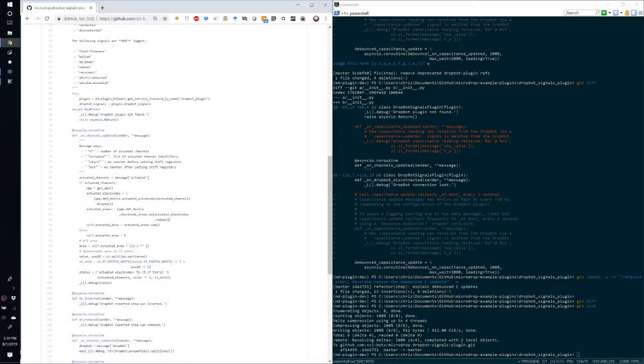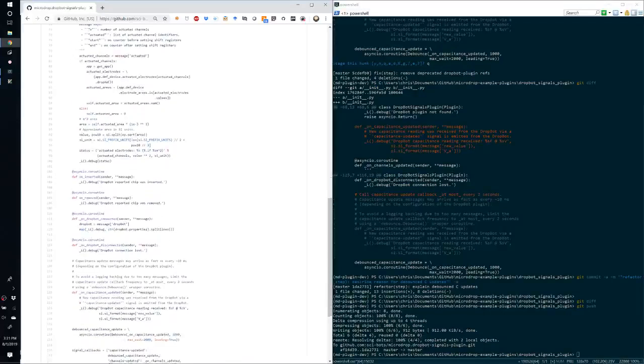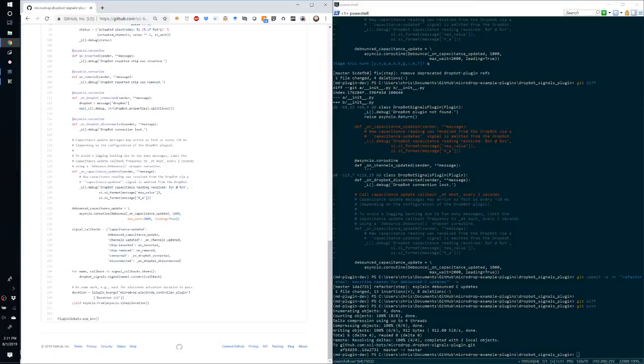want, and in this case our implementation relies on that, because on the next step these callbacks will be registered again, and in that case we don't want the callbacks being called twice for every signal. So that is the desired behavior, but it may be unexpected if you weren't thinking that that's how it worked.